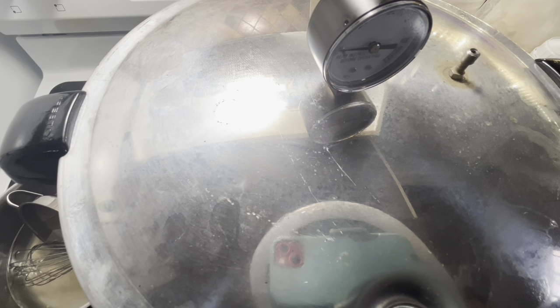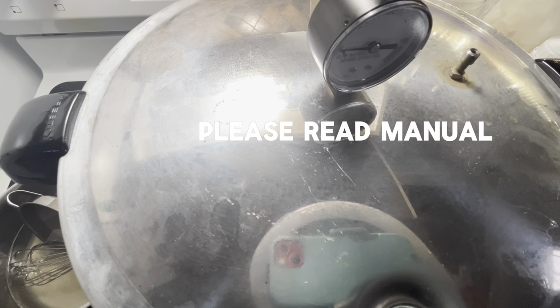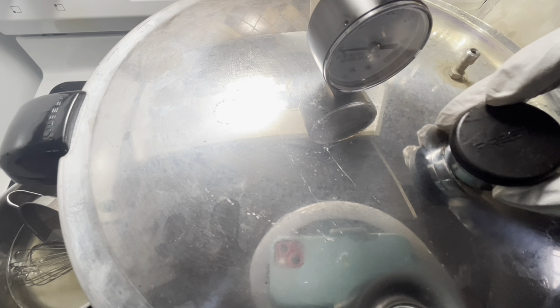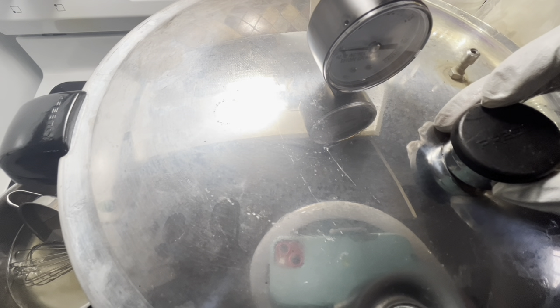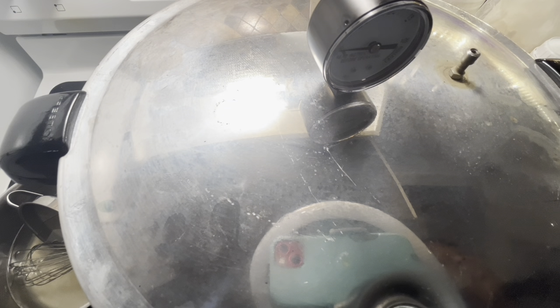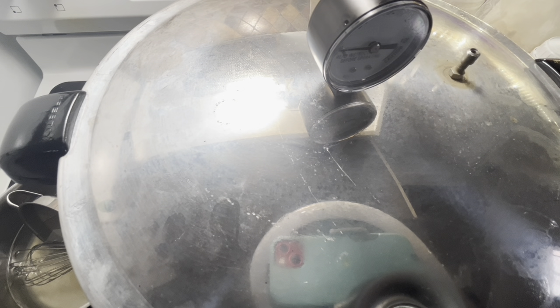Check your altitude — I know it's at 15 PSI when the rocker is rattling. If you're at a higher altitude, you may need to add a penny or two on the rocker; look it up and figure it out. Make sure you're sterilizing correctly and using your pressure cooker correctly. I suggest watching videos on how to use a pressure cooker — like moms at home canning and preserving food. They have a lot of good info. That's how I prepare agar.